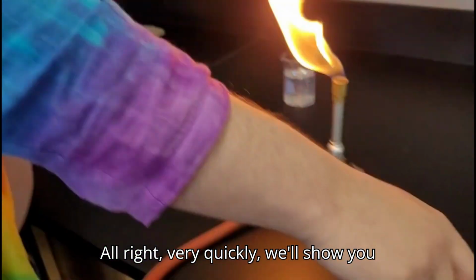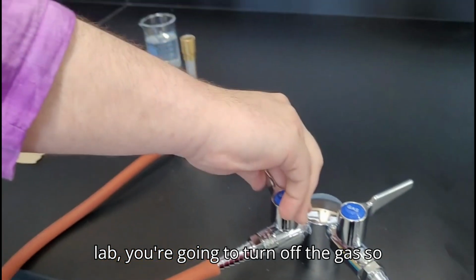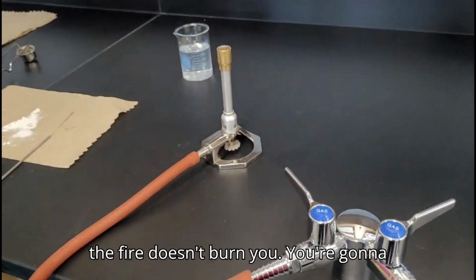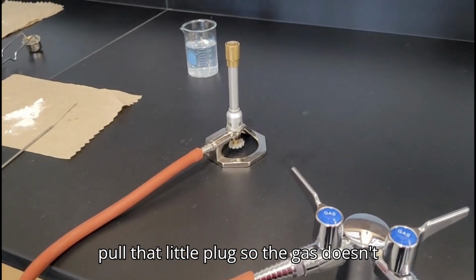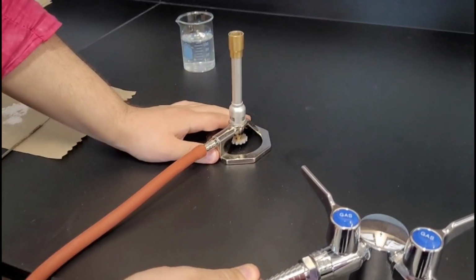Alright, very quickly we'll show you what to do when you're cleaning the lab. You're going to turn off the gas so the fire doesn't burn you. You're going to pull that little plug so all the gas doesn't go back into it. Then you're just going to clean up the lab.